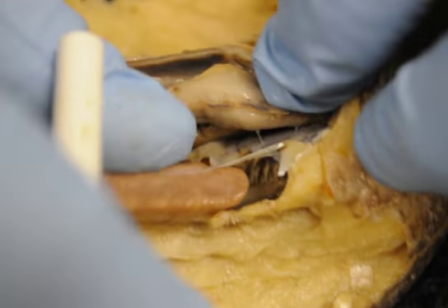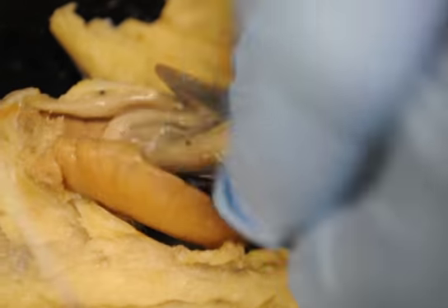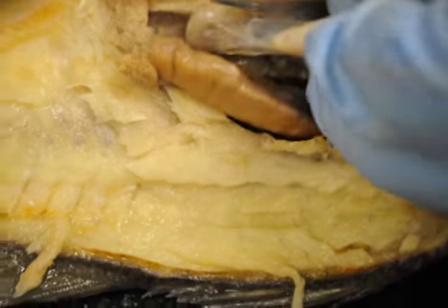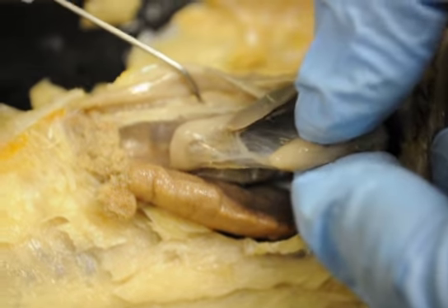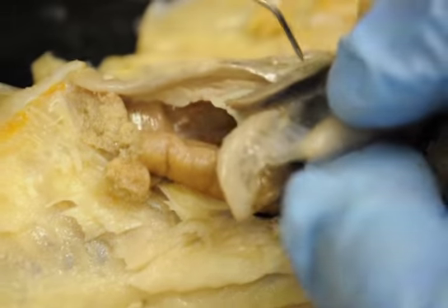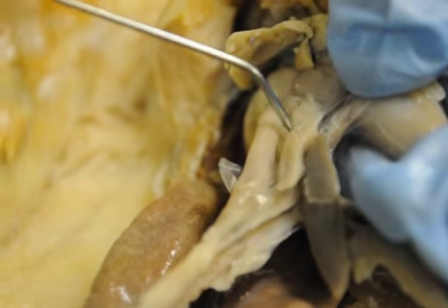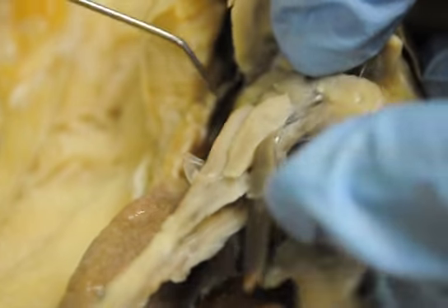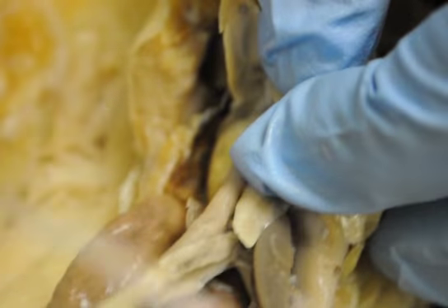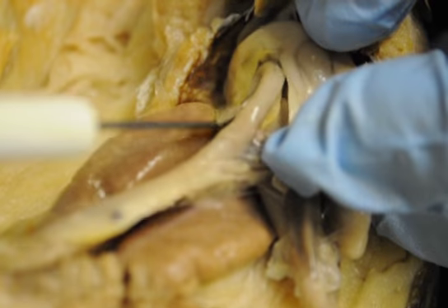This is my stomach here, and coming off of the stomach, you'll see these little finger-like projections. Let me get them out here where you can see them. These are the pyloric ceca coming off right here on either side. These little finger-like projections will be your pyloric ceca coming off of your stomach. That will come around, and this is the small intestines here. All this is small intestines.